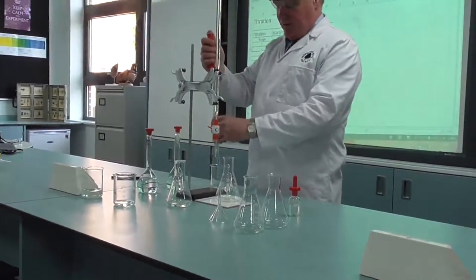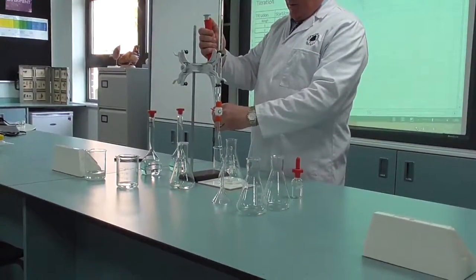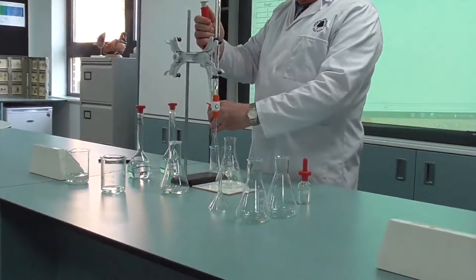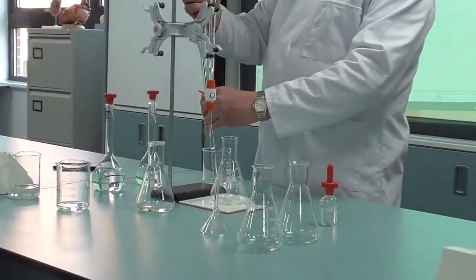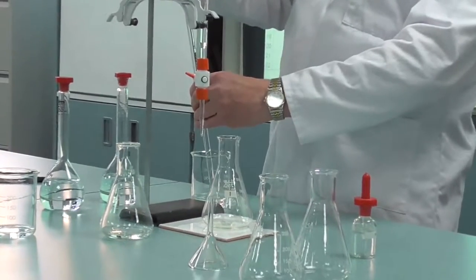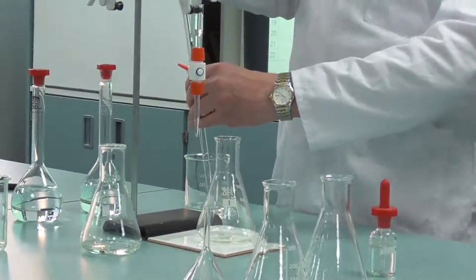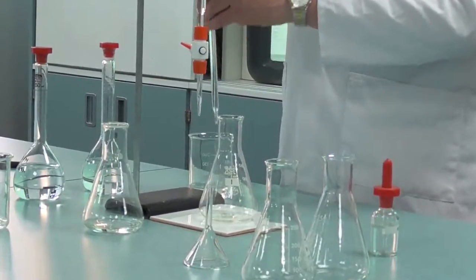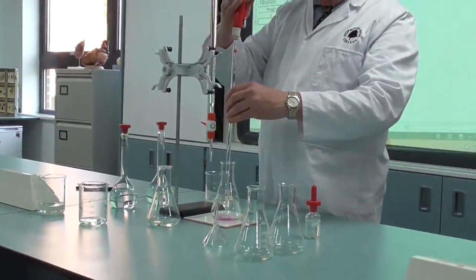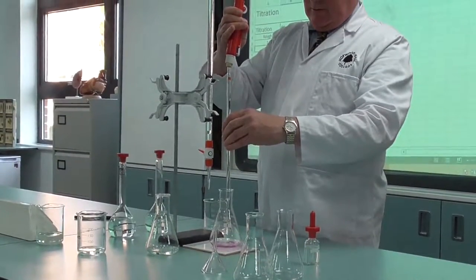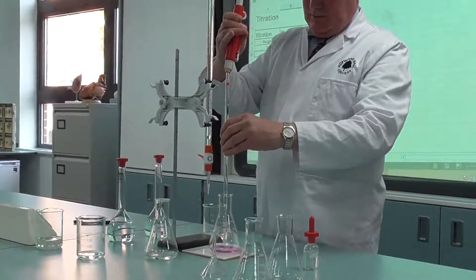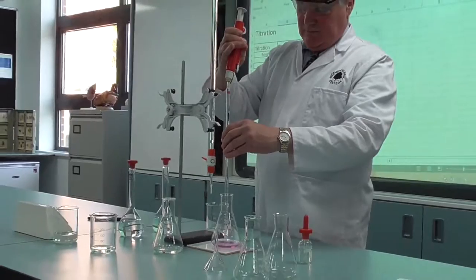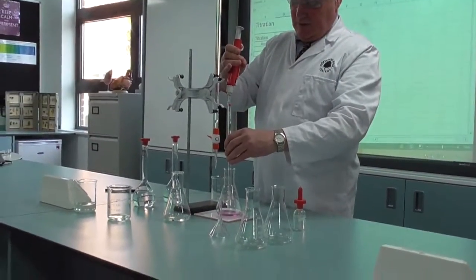I'm going to add the sodium hydroxide. Remember, you need to take it up to the meniscus. Now you have to look down, the meniscus is in that place. Transfer it, just dip it in the base.